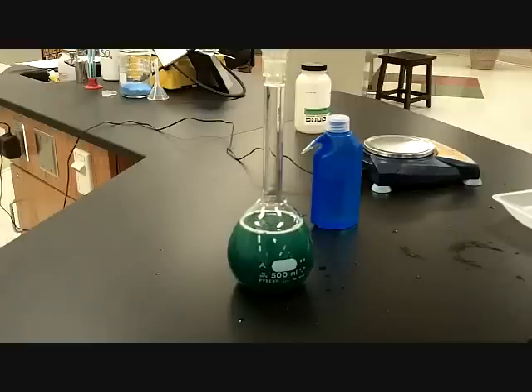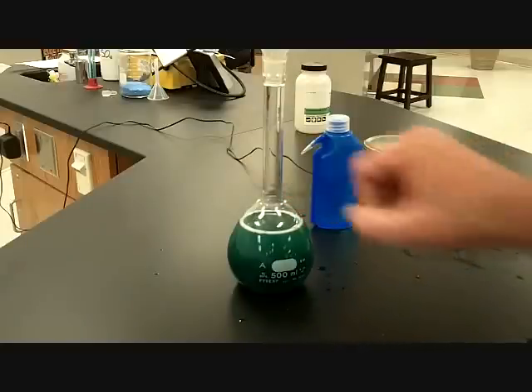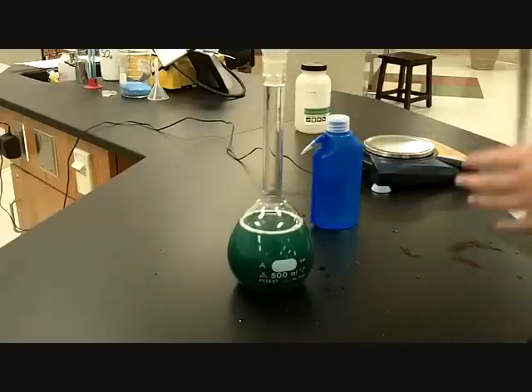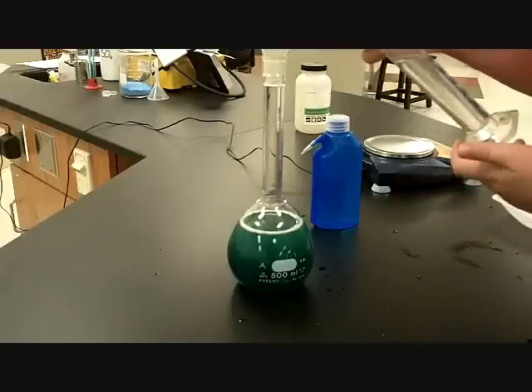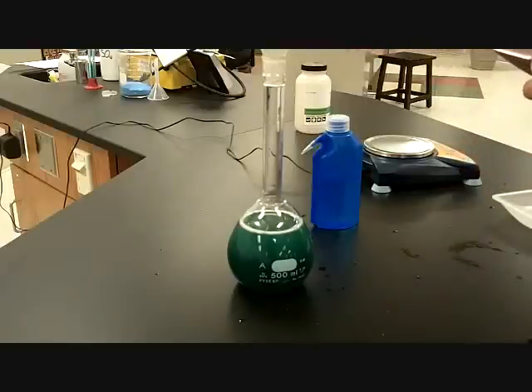All right, so now we're going to get a little bit more water there, Sam. Go ahead. Get a little bit more, maybe about 50 mils. Go ahead and put 60 in. We may not use it all, but that's okay. Got it? Okay. All right, now here's what I want you to do. I want you to add enough water until this level starts getting into the neck, okay? All right. And again, where we're shooting for is that line right there. So go slow on this.